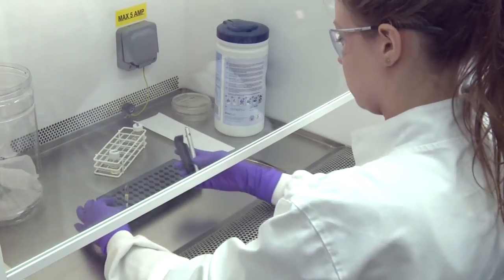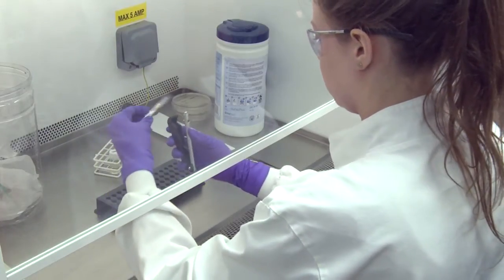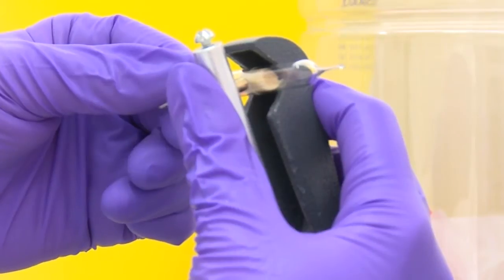Using a diamond cutter, make a deep score around the circumference of the ampoule in the centre of the cotton wool plug.